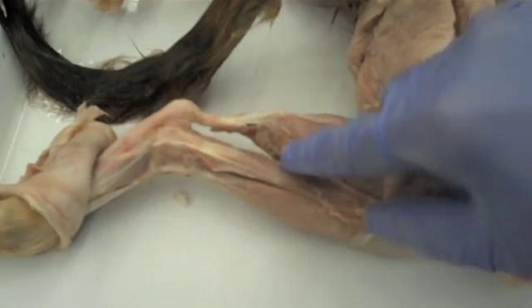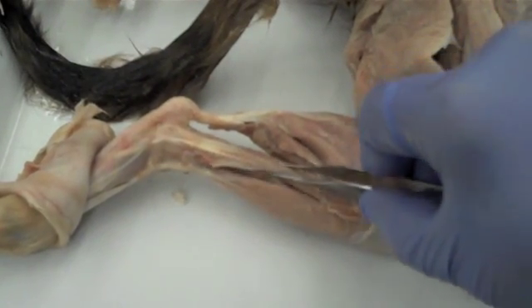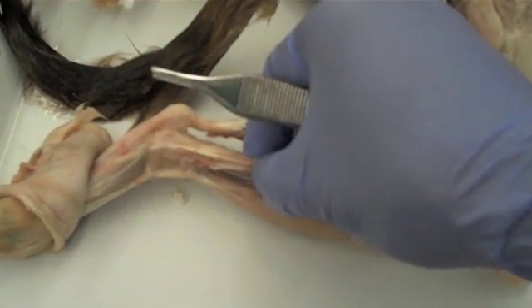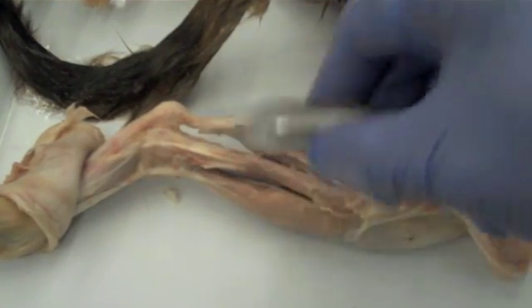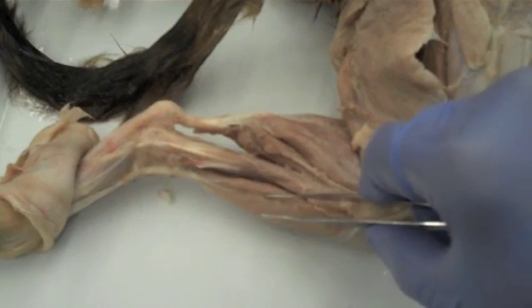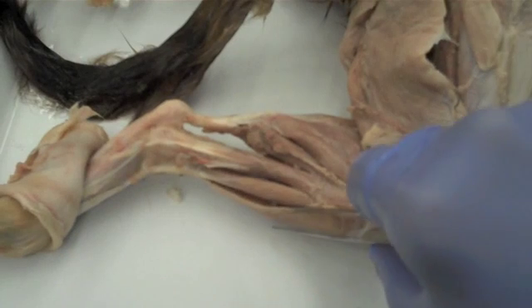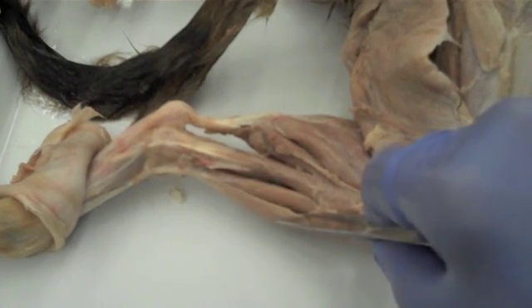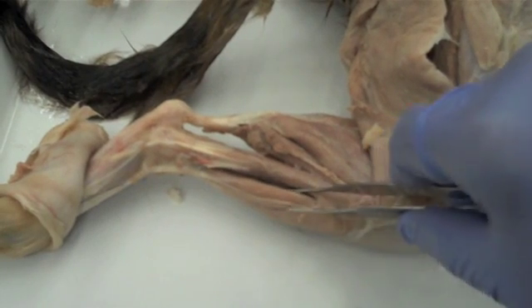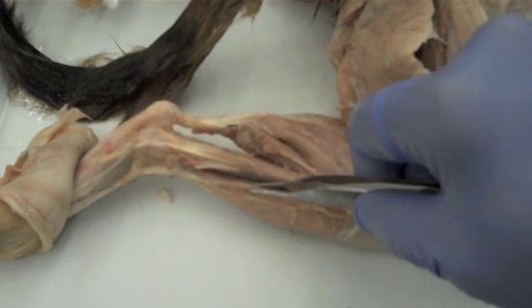Also visible on the lateral leg we have the fibularis muscle group right here. If you feel underneath it you'll actually feel the fibula that they're attached to. More anterior to them we have two muscles: the extensor digitorum and the tibialis anterior. If you don't do a complete dissection, these actually package together and it's easy to forget that the extensor digitorum is there.